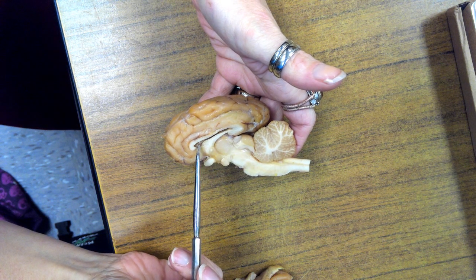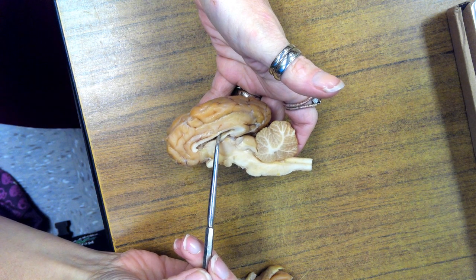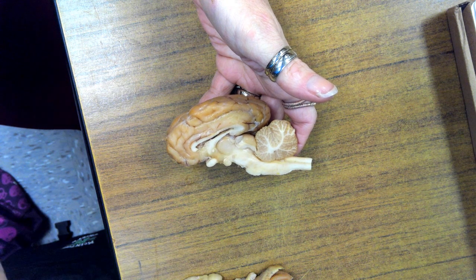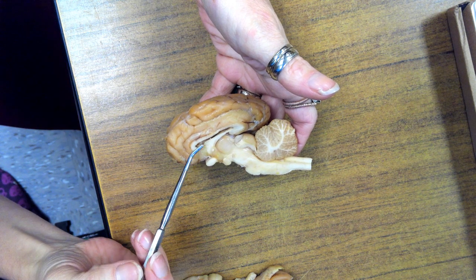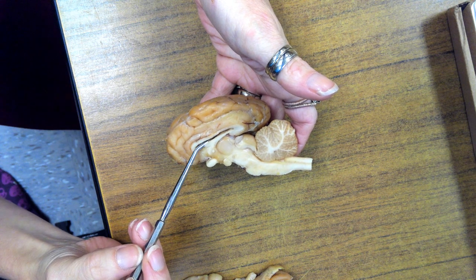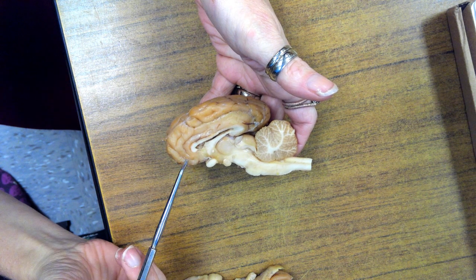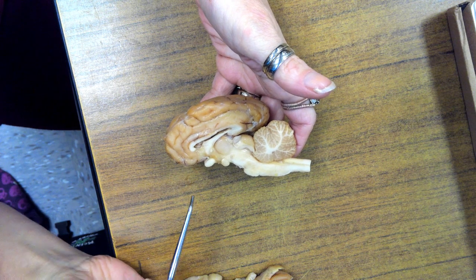Fornix. Underneath the corpus callosum, you have an empty space called a ventricle. There are two ventricles that are lateral to each other. This one is the right lateral ventricle, and the left lateral ventricle is on the other section of the brain. There is a membrane, which you cannot see here on this one, just a little tiny part of it, that separates the two lateral ventricles. So your left and right lateral ventricles are the first and second of 4 ventricles. These ventricles have cerebrospinal fluid in them, which moves.